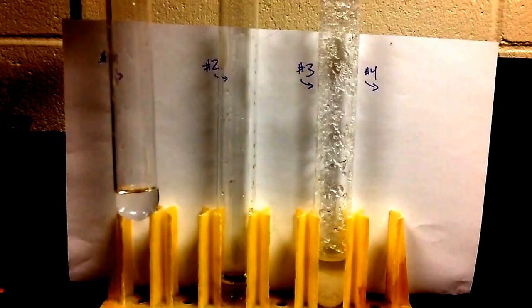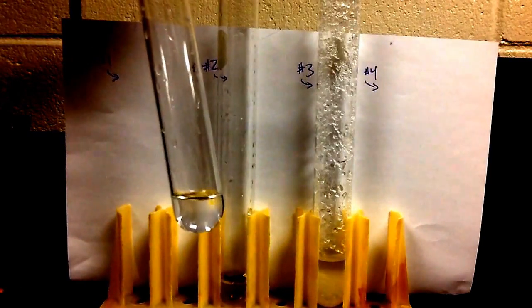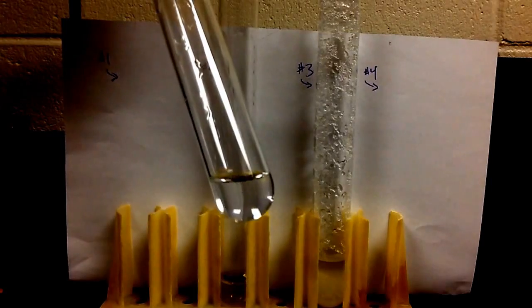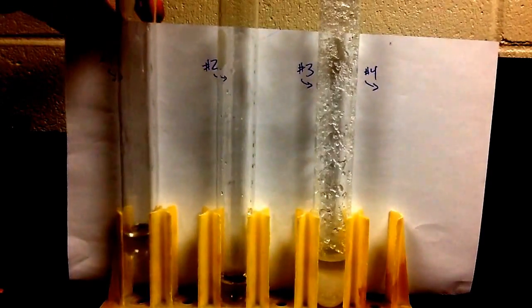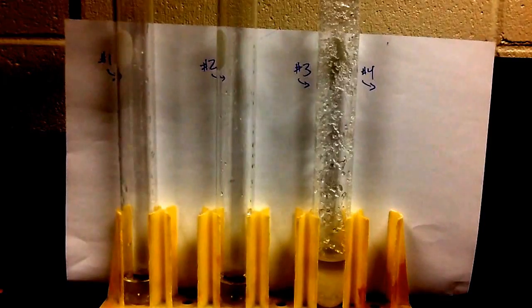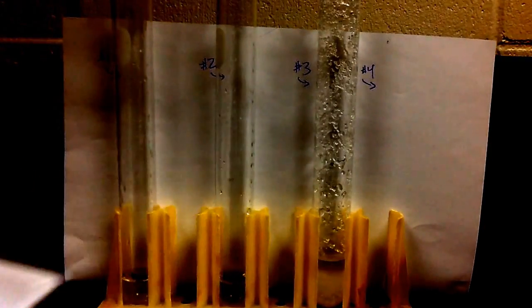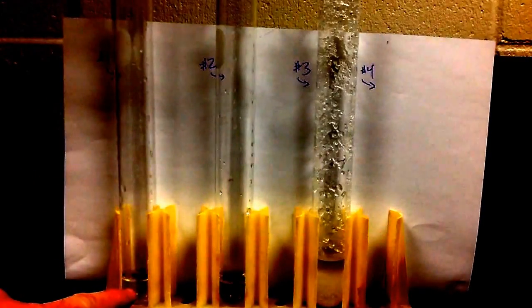And then we added 0.5 grams of sodium acetate to it, and when we did that, it dissolved. So here's our sodium acetate, it's a little white chemical, and it all dissolved in here.